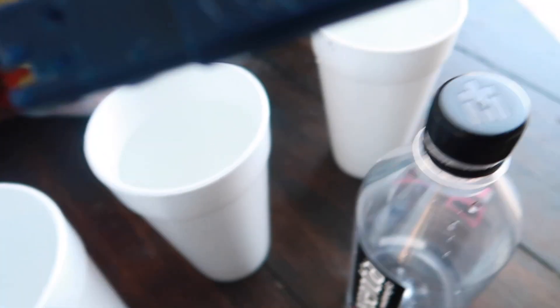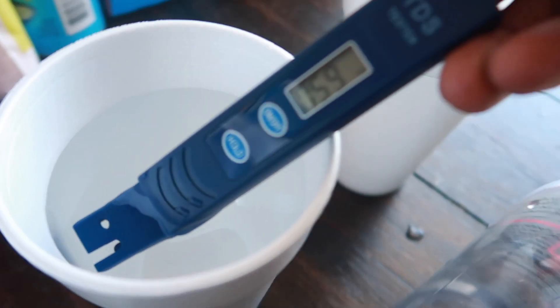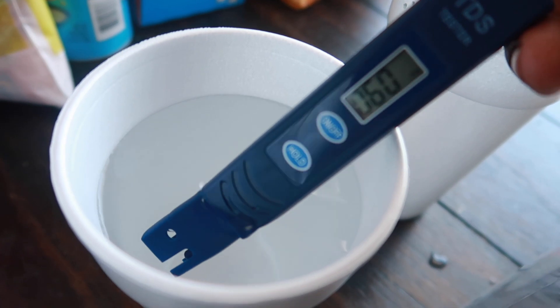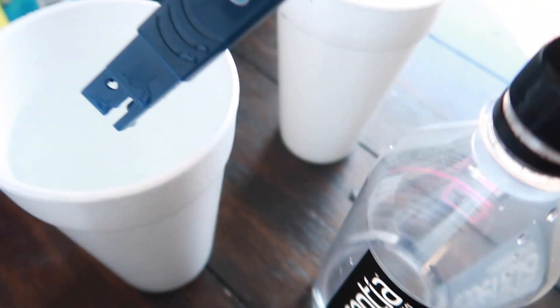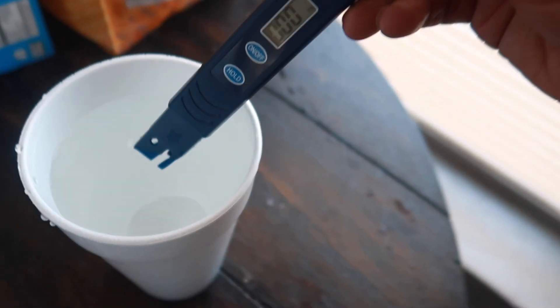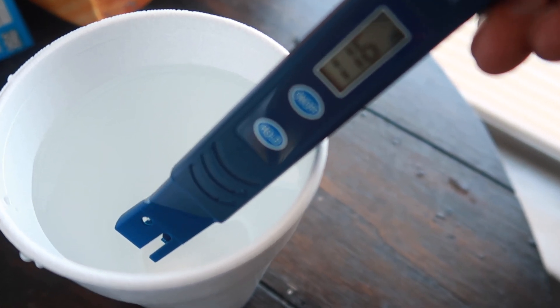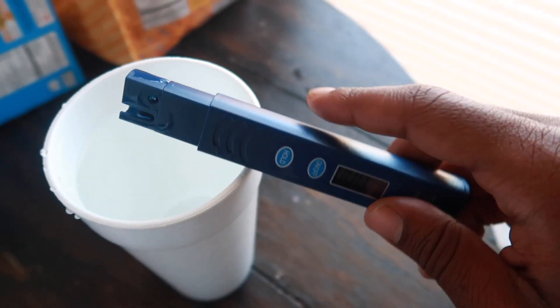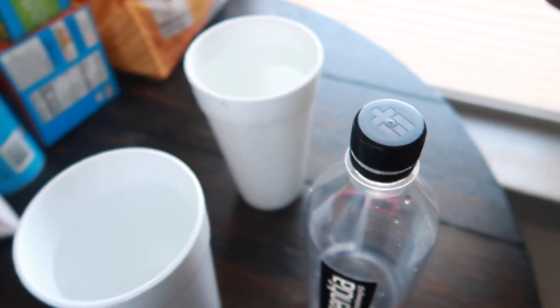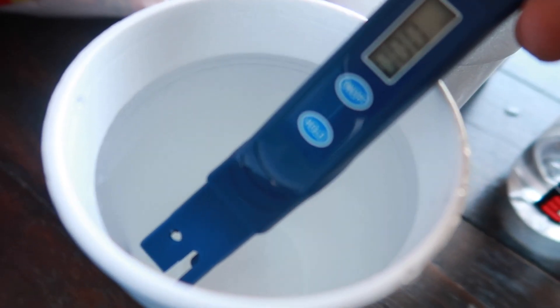Let me check the others in real time so y'all can see it. The Essentia is reading 58, 59, 60 ppm. Next, drop it right into the Flint water — Flint water is reading 117, 116. Now to check for cross contamination, I'm going to dry it off the same amount I dried it off before and drop it right back into the Zero Water — no cross contamination. Still reading zero, even sticking it in deep.